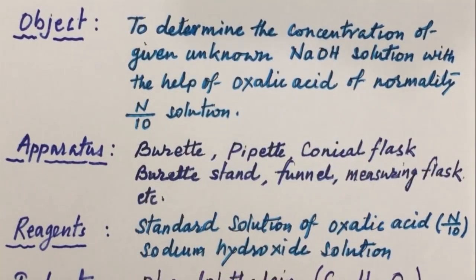Today our objective is to determine the concentration of a given unknown NaOH solution with the help of oxalic acid of normality N by 10 solution.